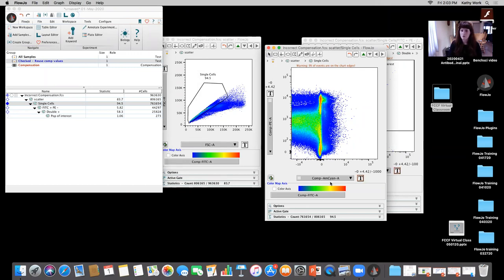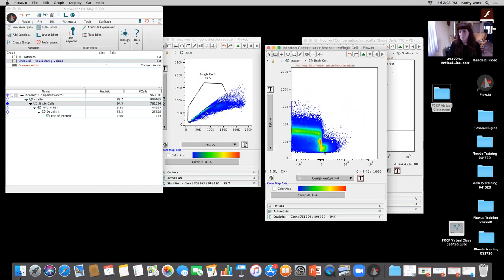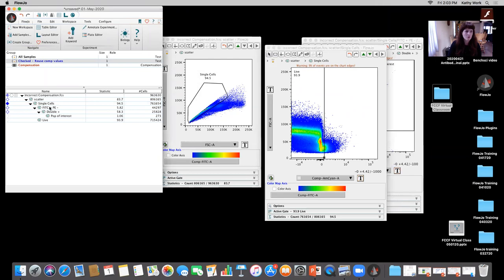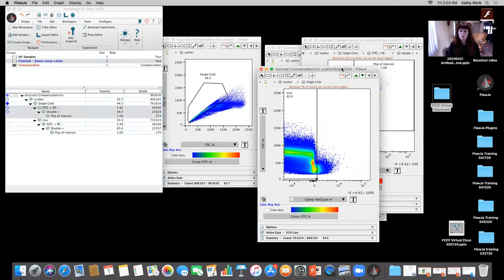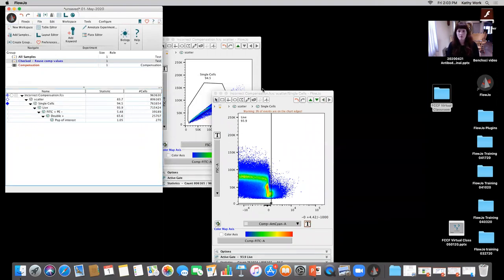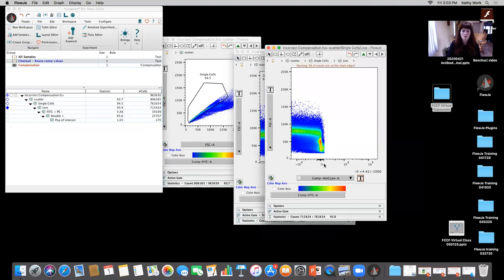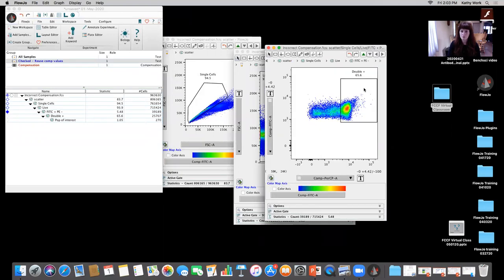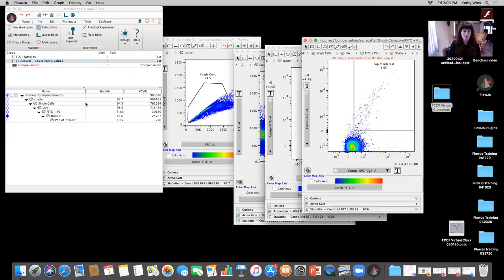And for this experiment, what they did, they plotted it versus forward scatter, and they set the gate right about there, and they called those live. I'm just going to move the rest of these down there. Okay, I'm going to delete those. So now I have my live cells included. Okay, and I'm just going to double check my FITC PE, PerCP. Okay, so now we have the live cells included.